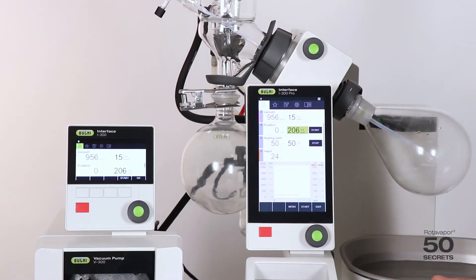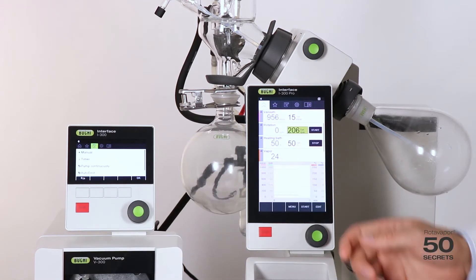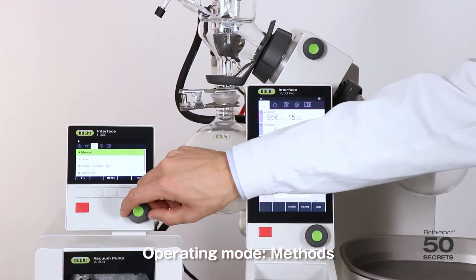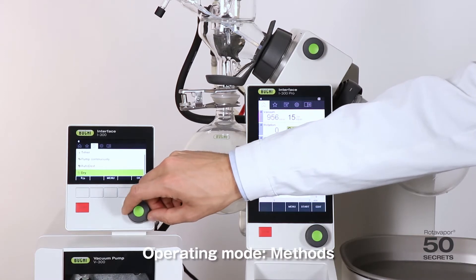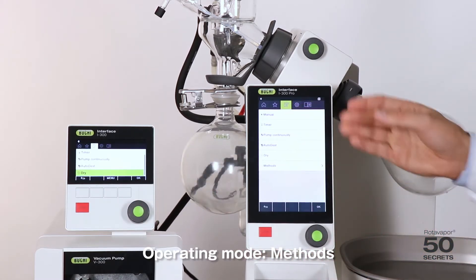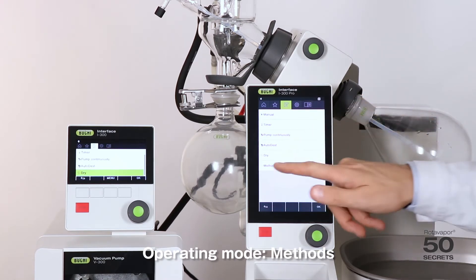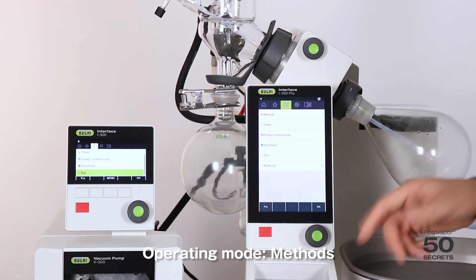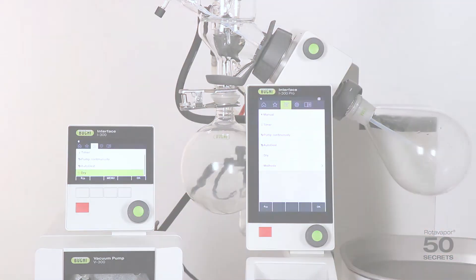The fifth difference is the operating modes. On the i300 we have manual, timer, pump continuously, auto-destillation, and dry. On the i300 Pro we have exactly the same, but in addition we have methods. The function of the methods we explain in a different rotovapor secret.